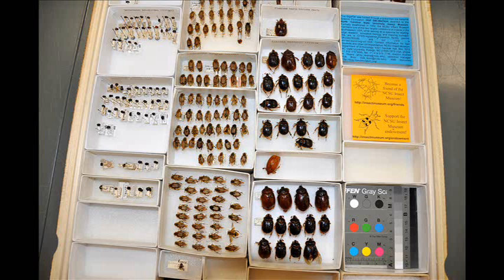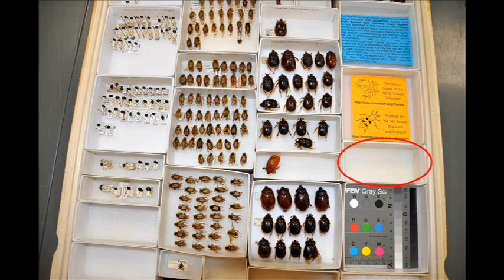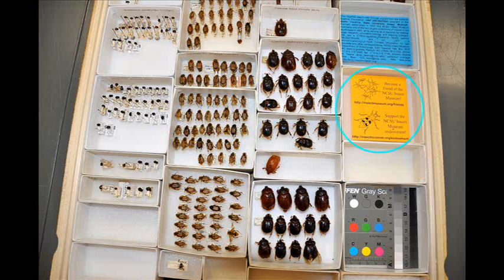After selecting the drawer to shoot, it is highly advisable to fill any empty unit trays with filler materials. We use small papers printed with text and drawings. The reason for this is that the camera sometimes has trouble focusing on large white spaces, even when the focus is locked. Large white spaces can also affect the stitching.